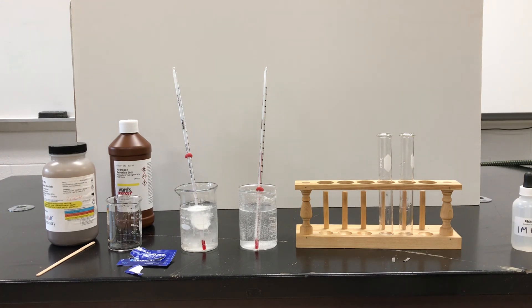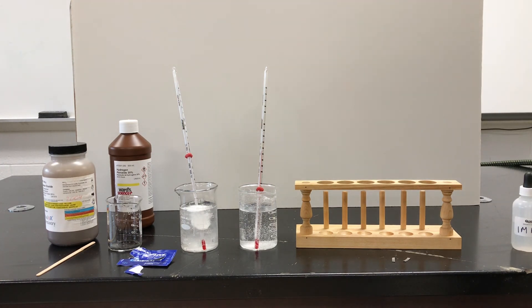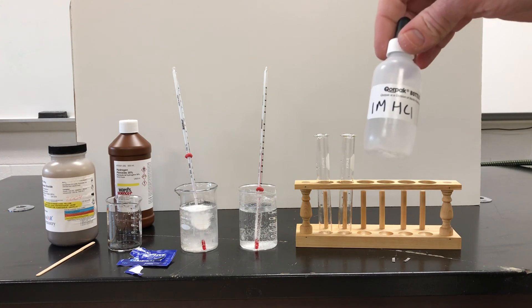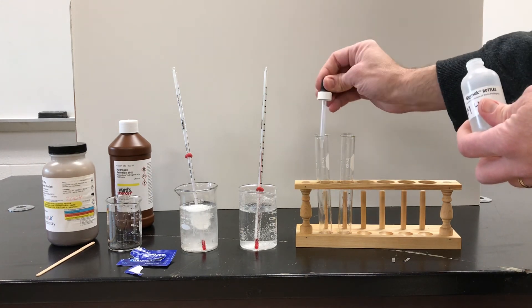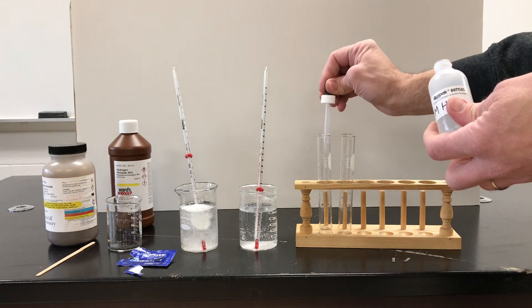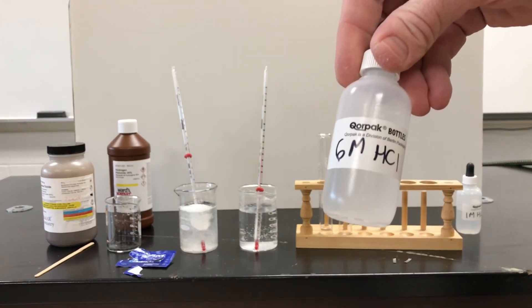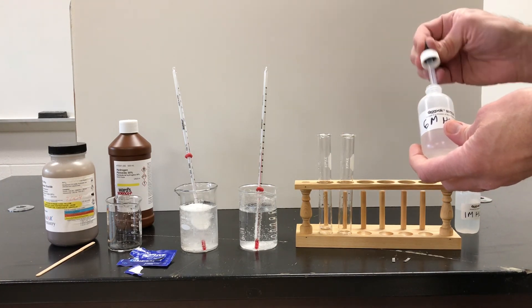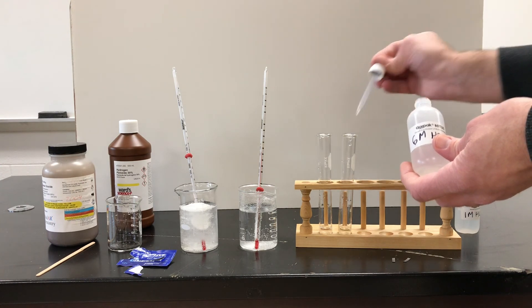The other thing I want to show you is concentration. Here I have two test tubes. In one of these, I'm going to put one molar hydrochloric acid, which is a decent concentration — three squirts. And then I have six molar hydrochloric acid, which is six times as concentrated as the previous acid — also three squirts. So we've got about the same volume of acid.